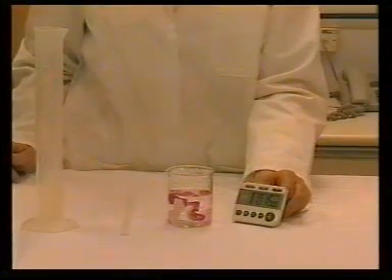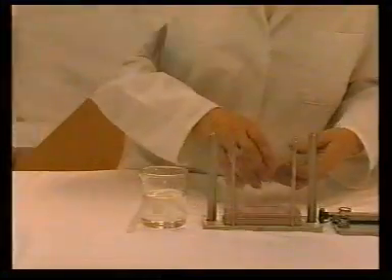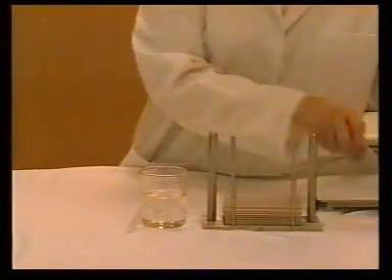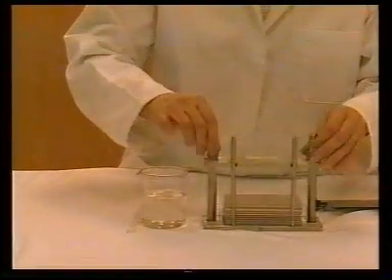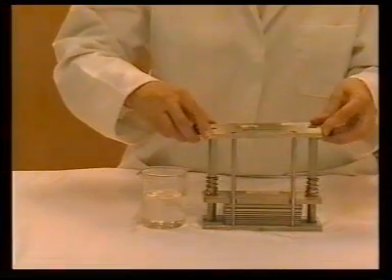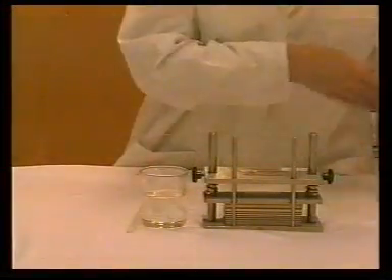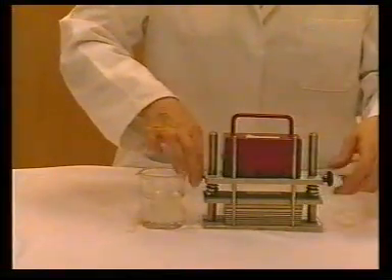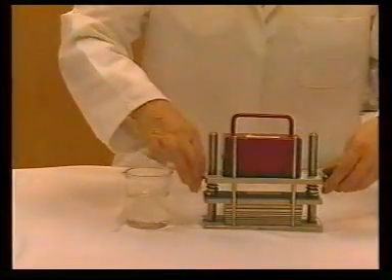After the specified time, the composite specimens are mounted between plastic plates and placed in the press. The press takes up to 20 such specimens, and when full, a loading weight is applied and the top plate fixed in position and the weight removed. Separate presses are used for the various test solutions.